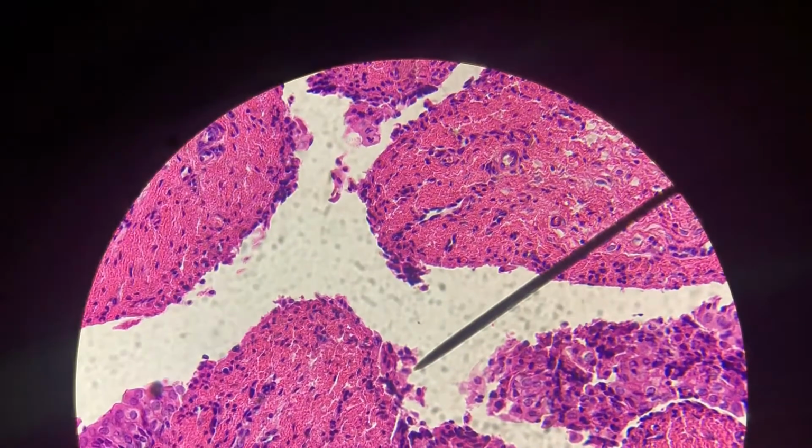And if you have cells stacked like this and they look squamous, you could say, well, how do I know that's not stratified squamous? And I would say because your stratified squamous tissues don't have a huge muscle under them like this one does.